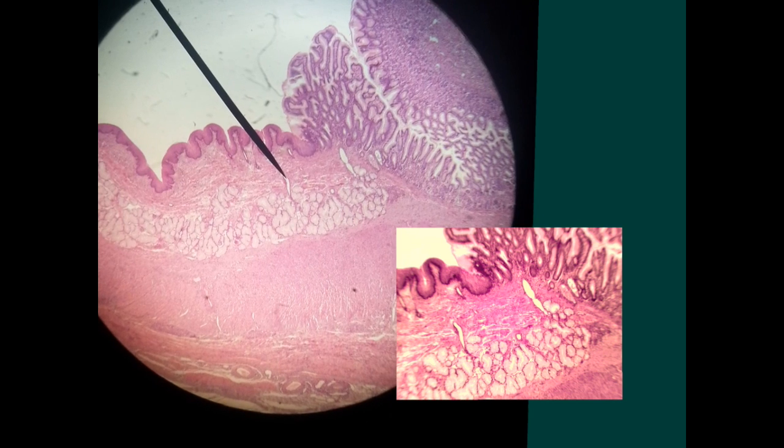Come to the next subgroup, which are the junctions. The junctions are very long in length, and we have two junctions only. We have the gastroesophageal and pyloroduodenal. This is the gastroesophageal. How can I know it? If you look at this slide here, you will notice that at one side you have this epithelium, which is the stratified squamous, has no striations, has no white spaces inside. This is a compact epithelium, no glands in this epithelium.